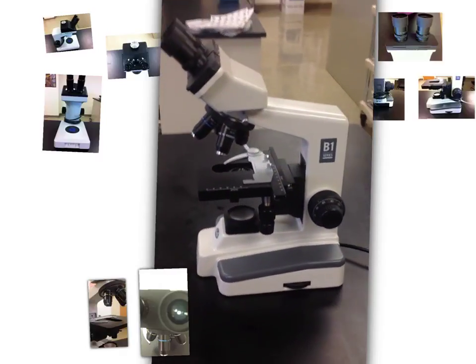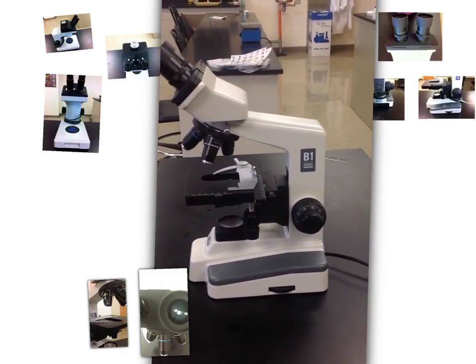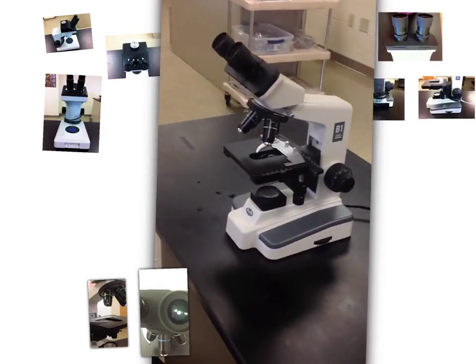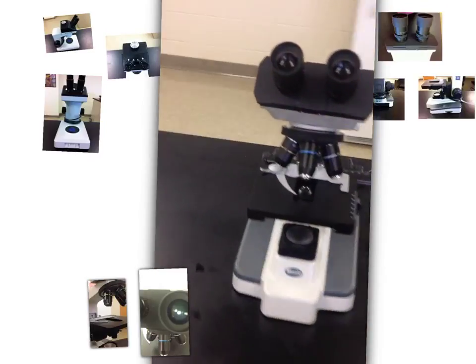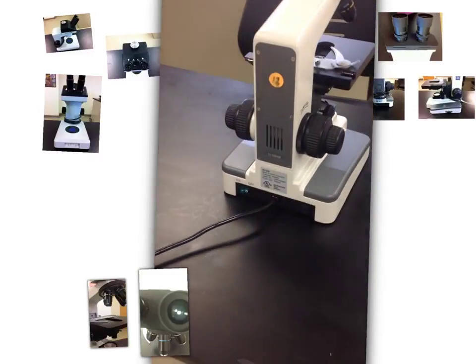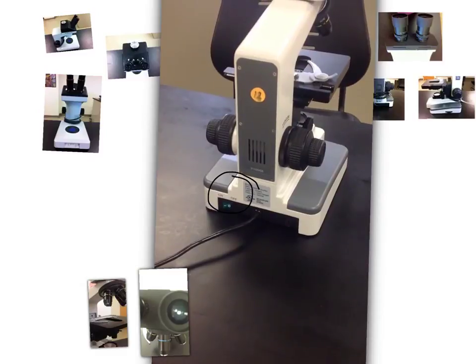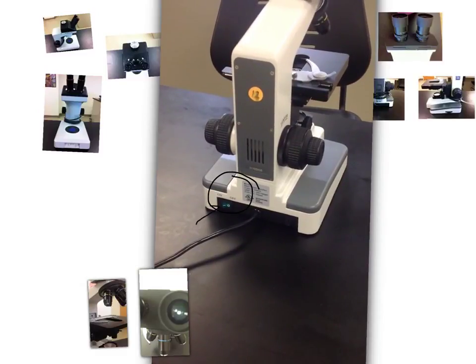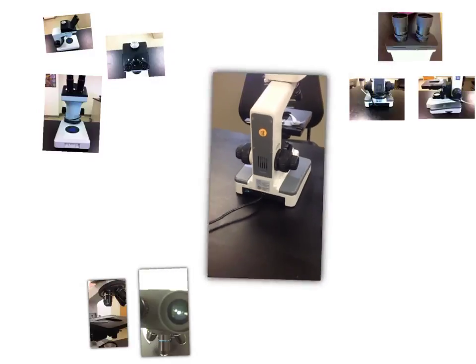So it's pretty fairly simple to use. I'm just going to swing around to the other side. I'm going to show you guys the back of the microscope. If you guys take a look at the very back, here we have something that's very important. This is our on and off switch. So most people think it's in the front of the microscope and here it is in the back.